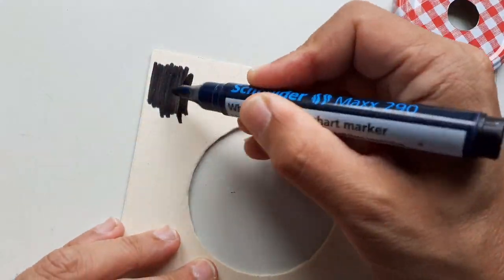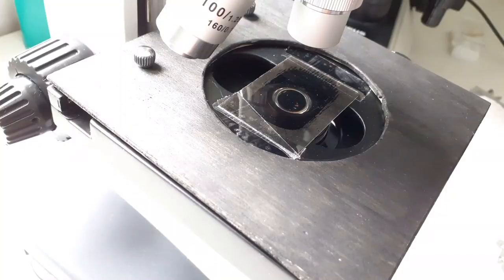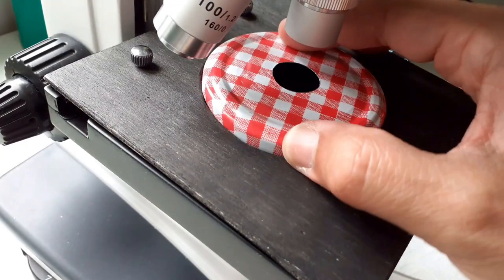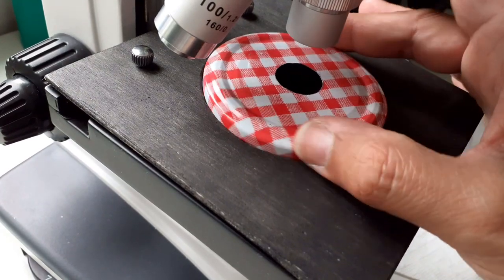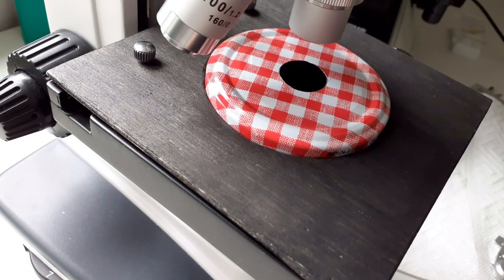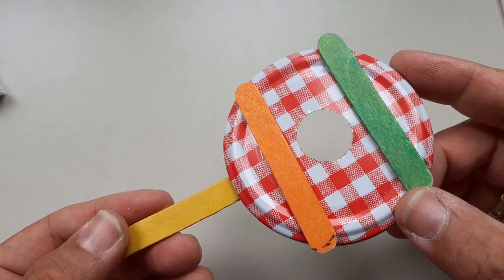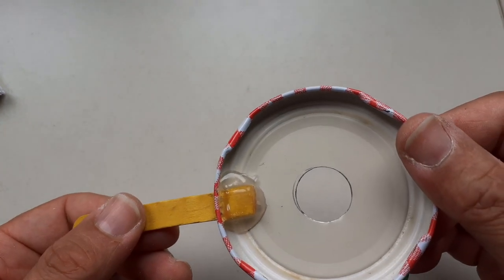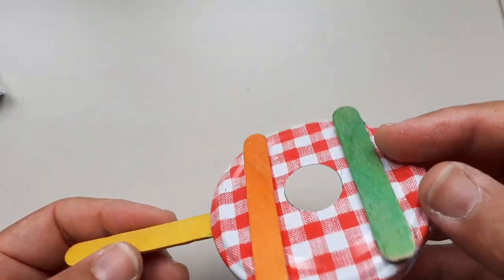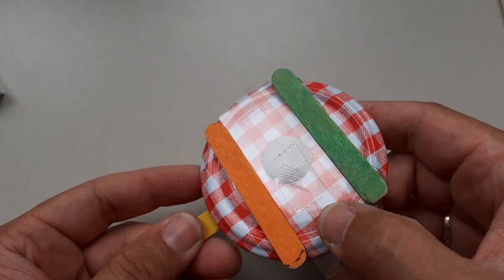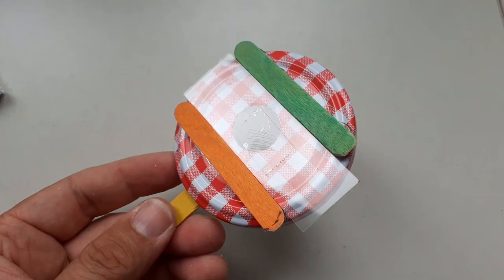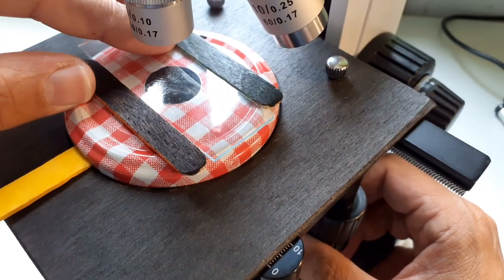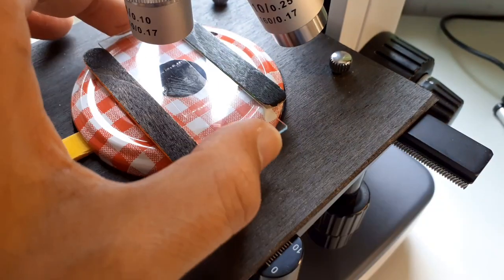The mechanical stage still works. Then for cosmetics, I painted everything black. This is basically how it now looks like. I also attached a small handle using wooden popsicle sticks. I used hot glue to do that and two horizontal popsicle sticks as a tray to carry the slide.